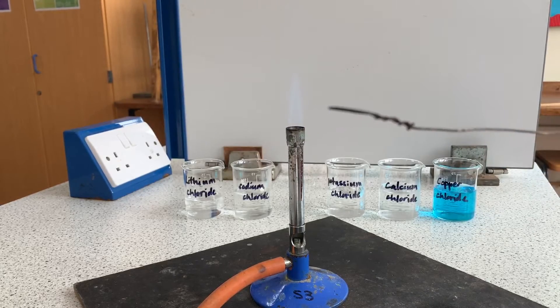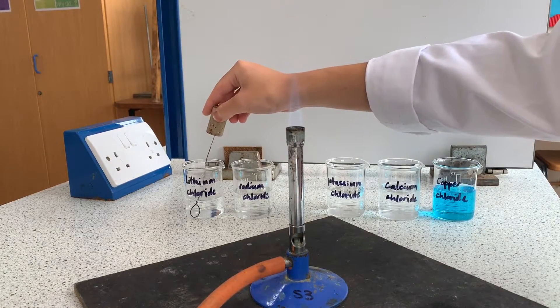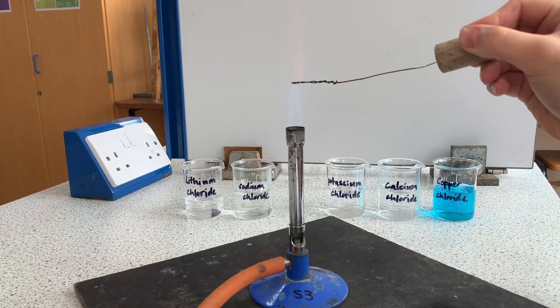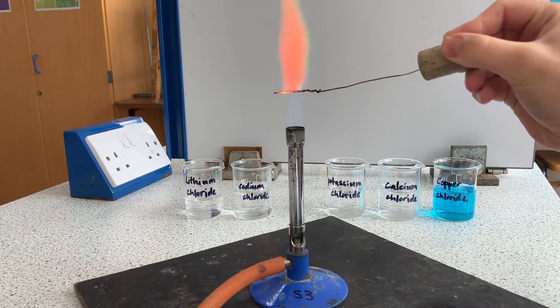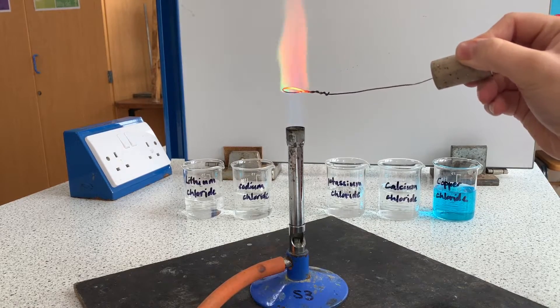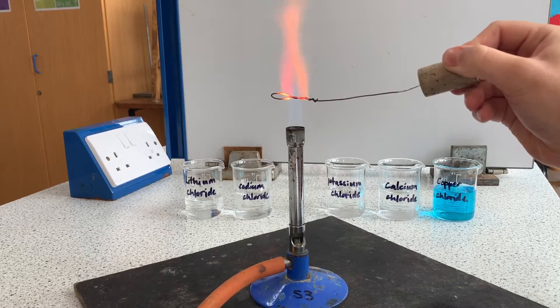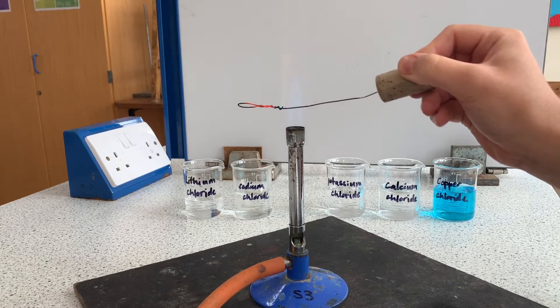Firstly I'm going to dip this nichrome wire into the lithium solution and then hold it into the flame. You can see the flame is this red color so from our options it's likely to be crimson or red. This is known as a crimson flame and when we compare it to the red later you'll see this one is much deeper, which is why we differentiate it and call it crimson.